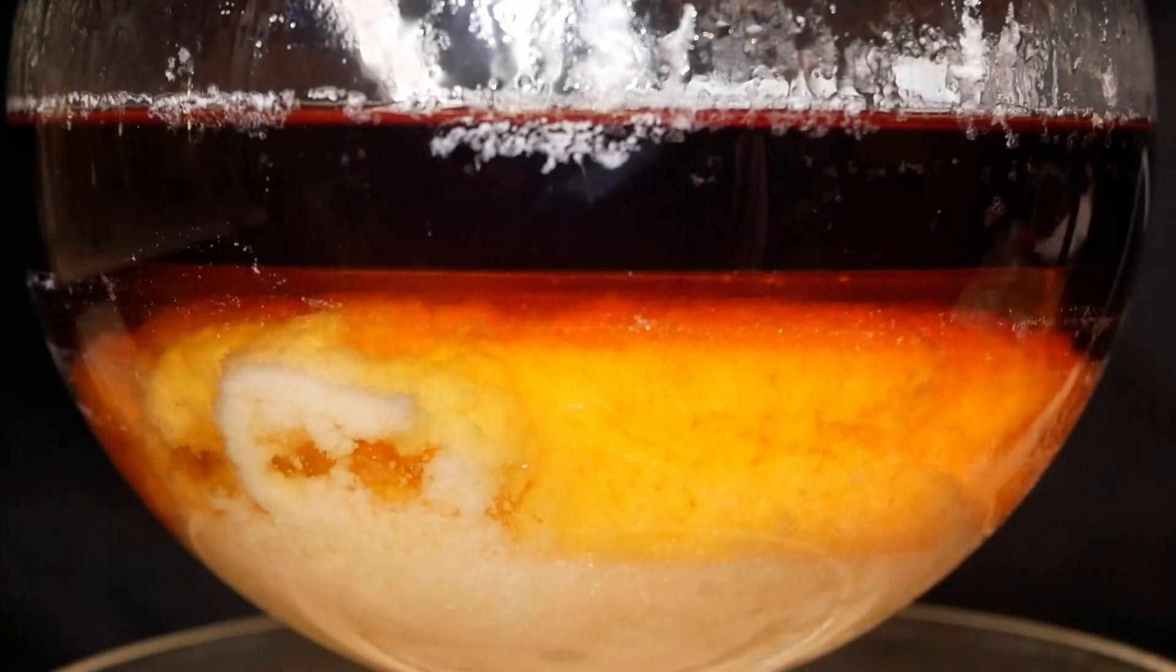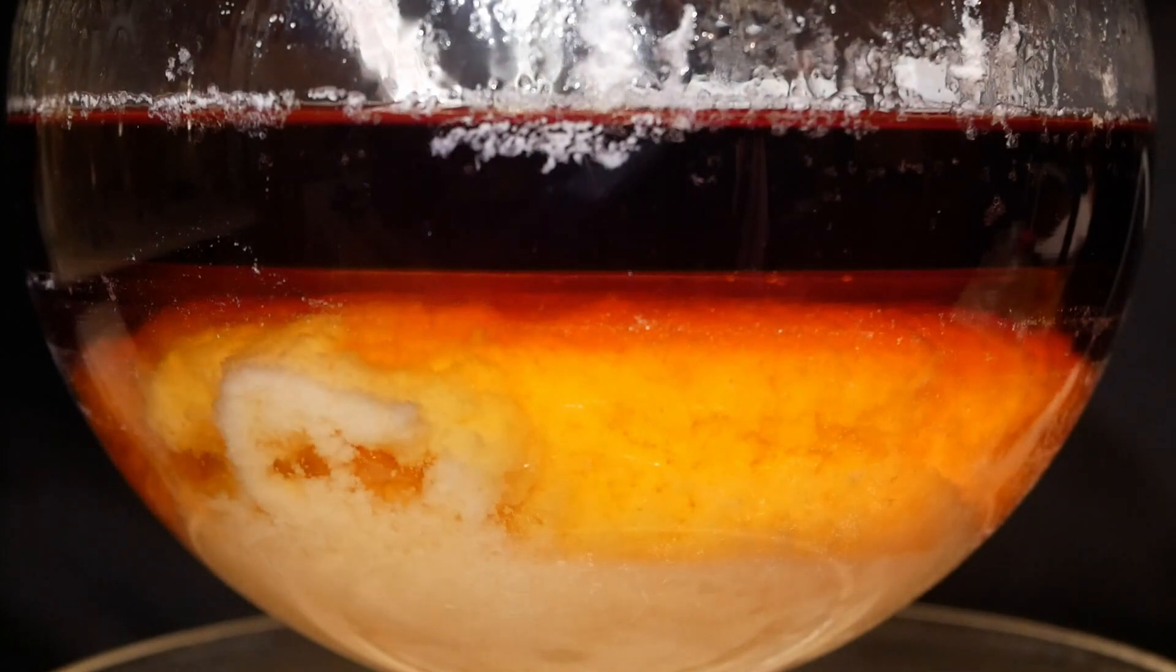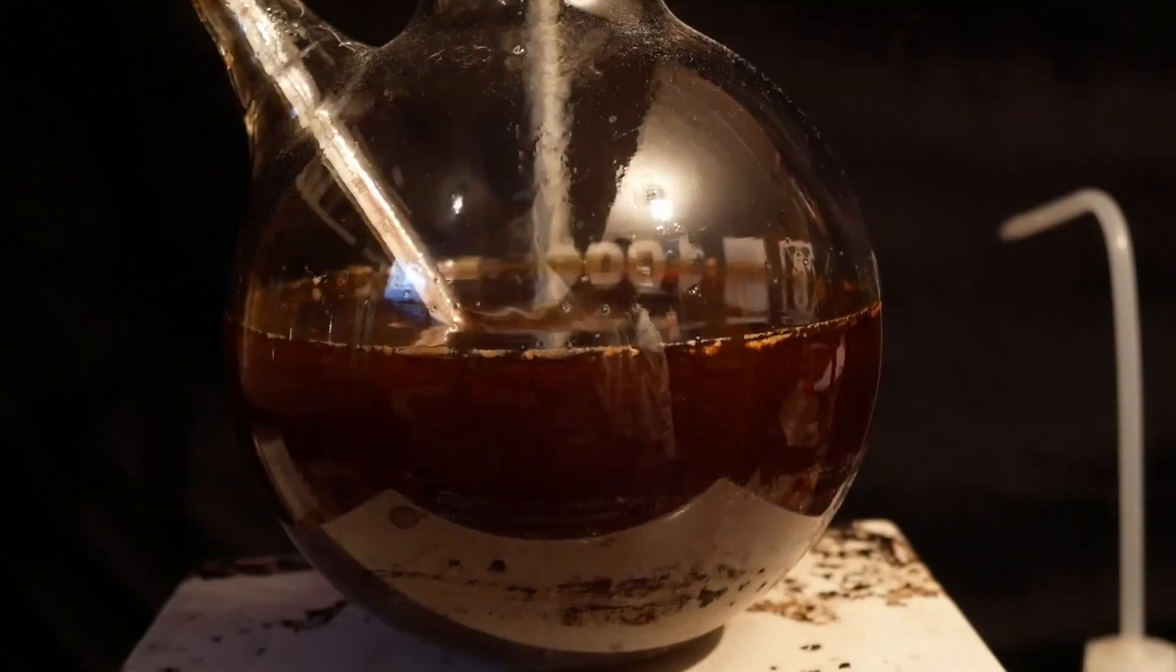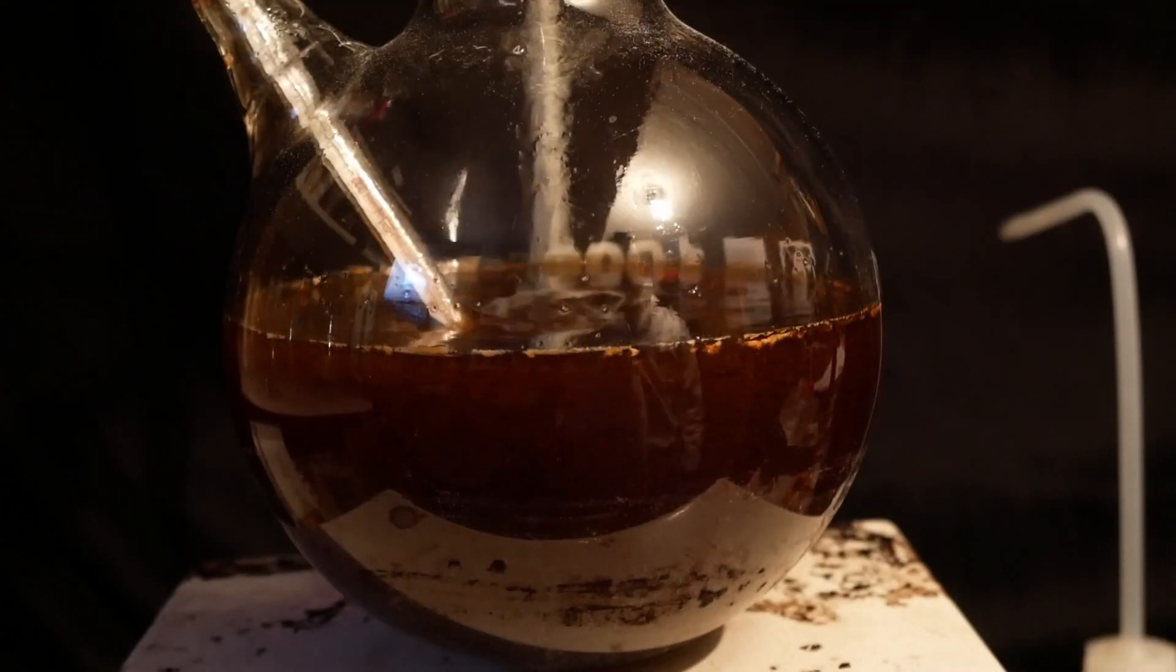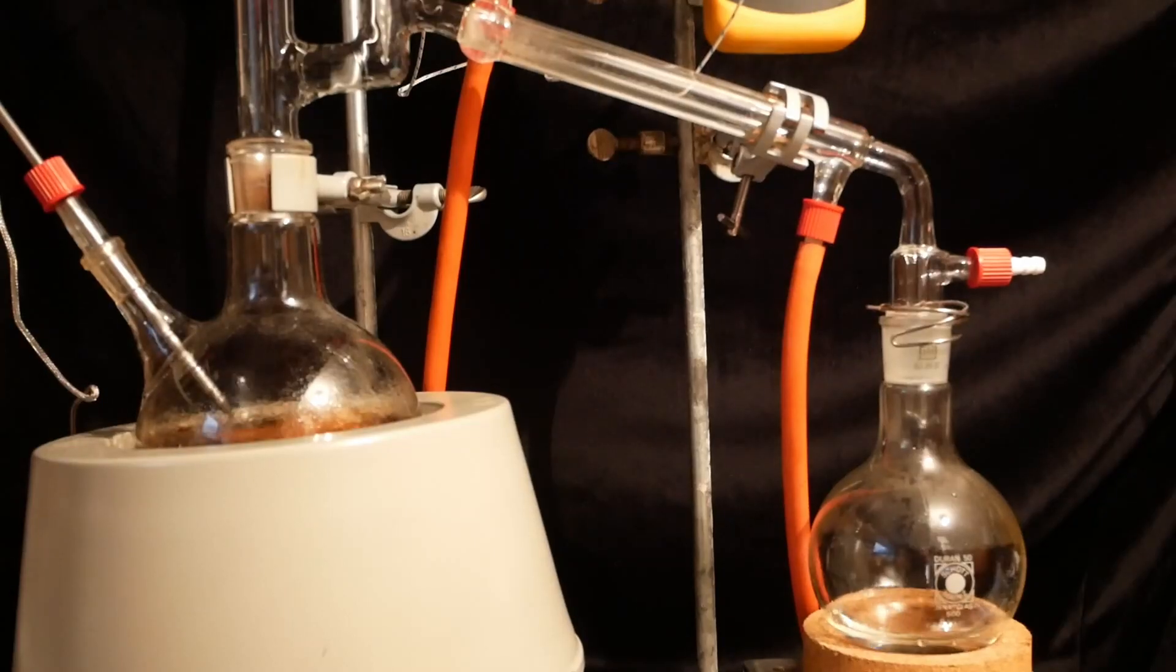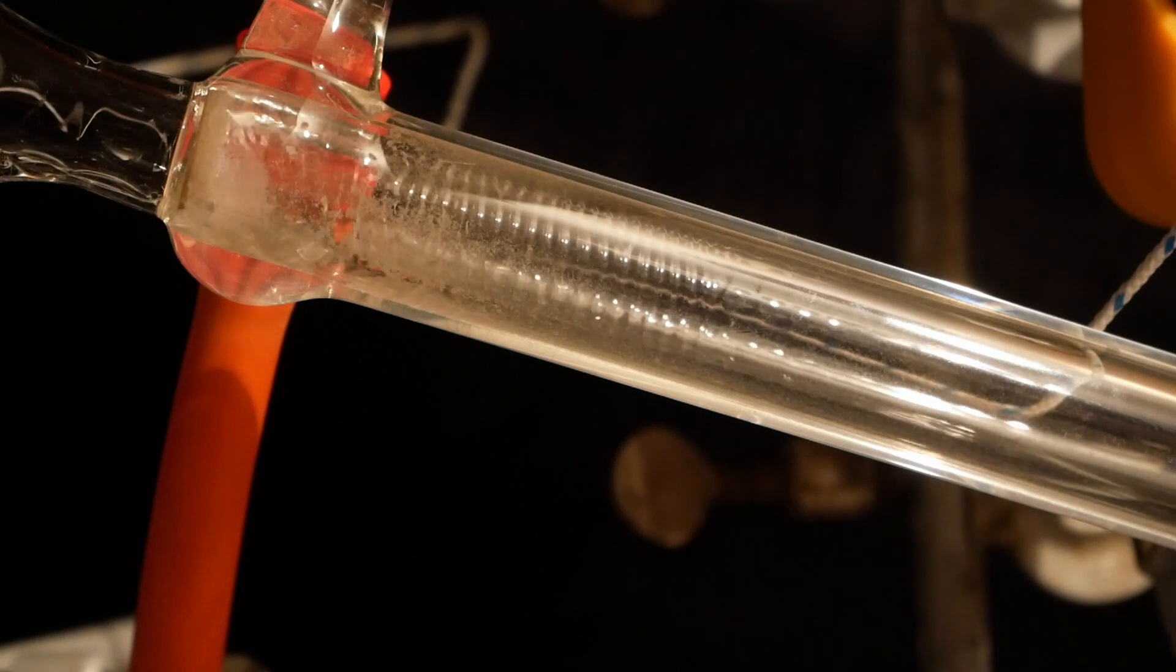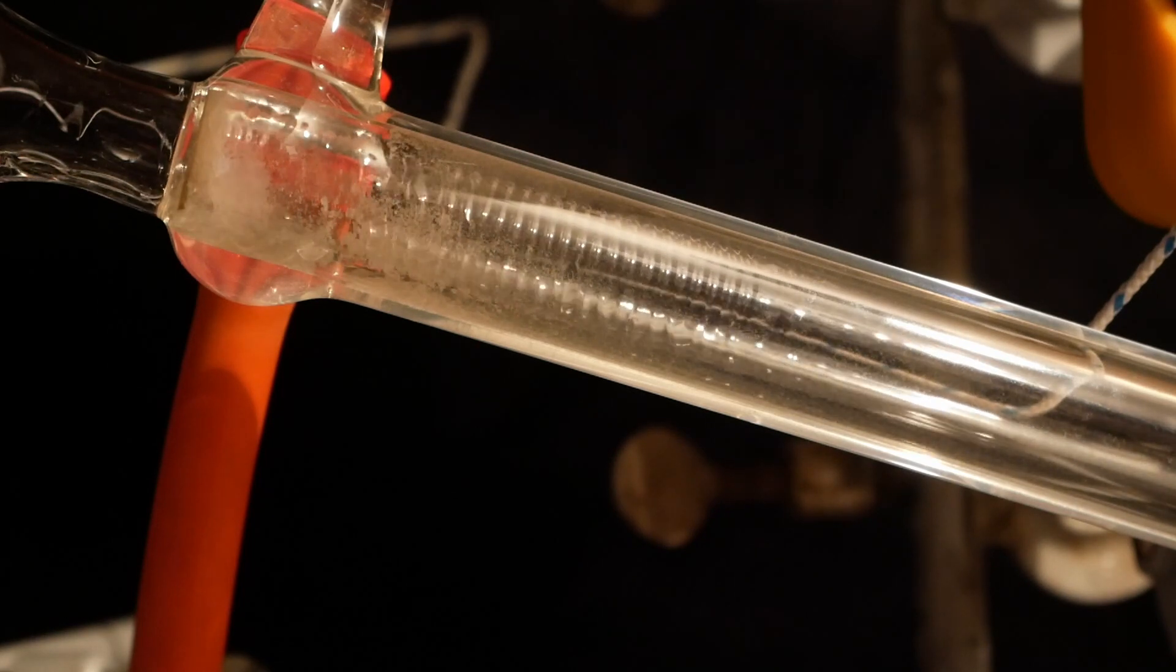The solution is once again stirred overnight and heated to 80°C for an hour and then separates into a beautiful deep red layer with some nice white flakes at the bottom. I then acidify to a pH of 1 and re-alkalize to about 10 with sodium hydroxide solution. Now with the dioxane in the flask, it's not as simple as just steam distilling up the aniline, because now there's also a dioxane-water azeotrope boiling before the aniline at around 80°C. So I distill that off first and it also creates this mesmerizing ripple effect in the condenser that looks very trippy.